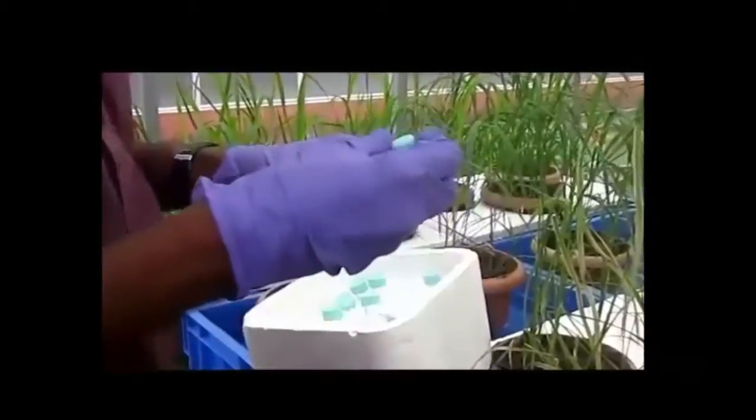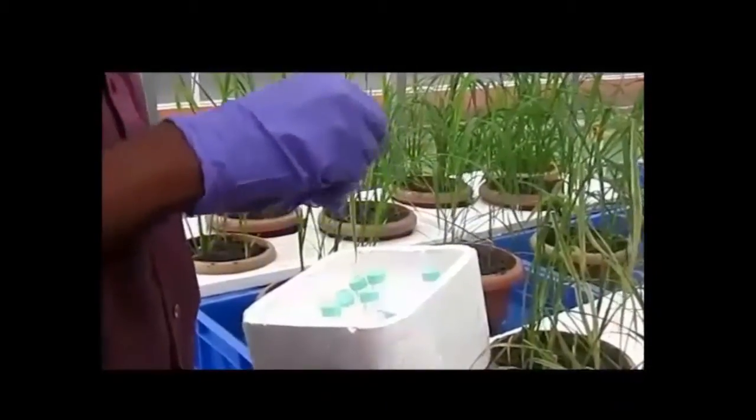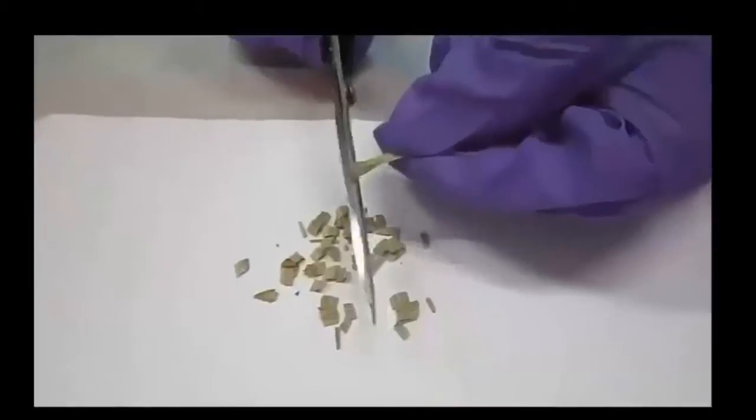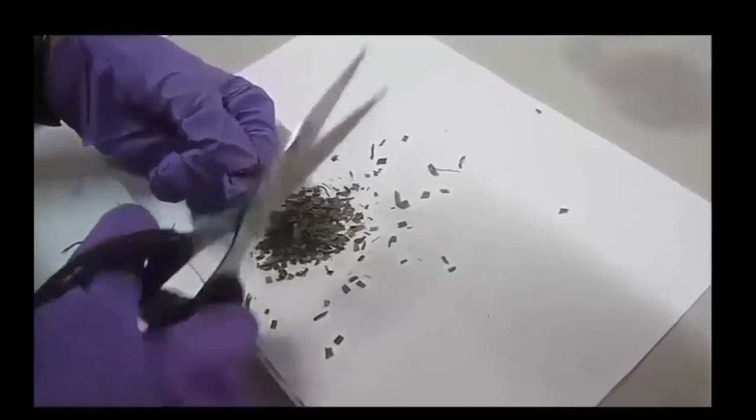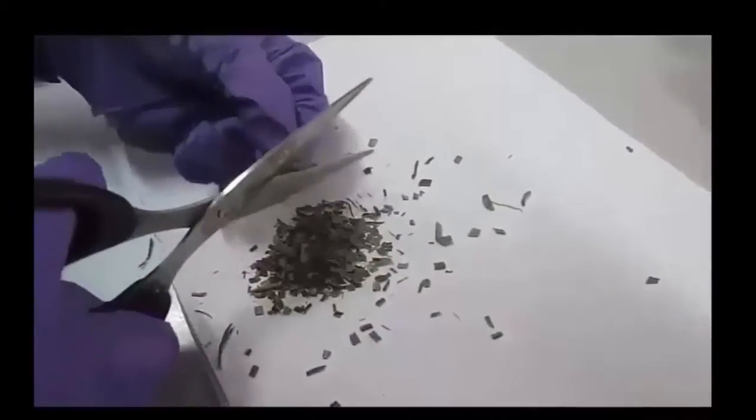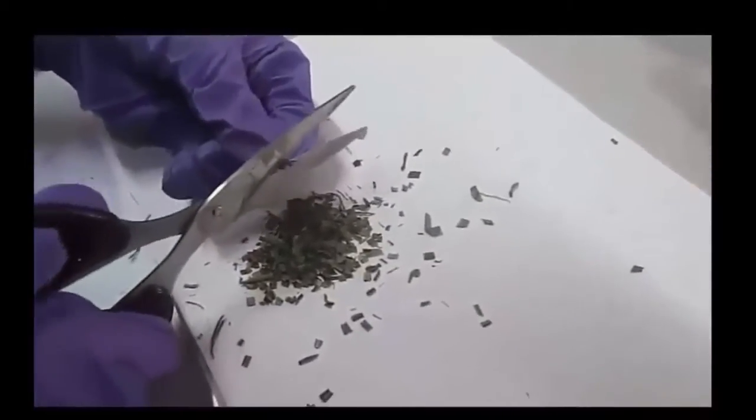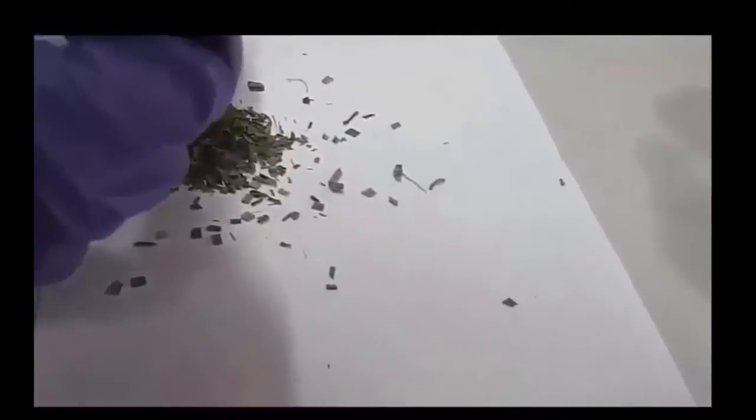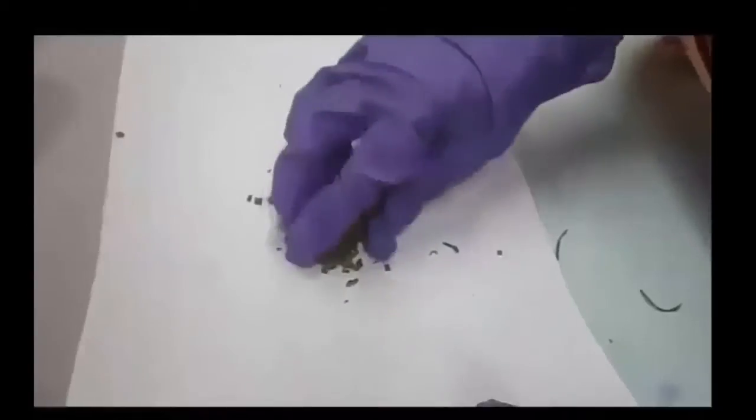Drying of samples is done to reduce the moisture level and to get constant weight. After drying, the samples are cut into small pieces and mixed well.